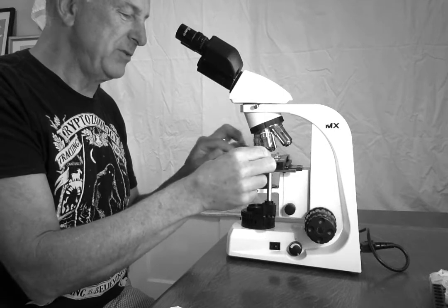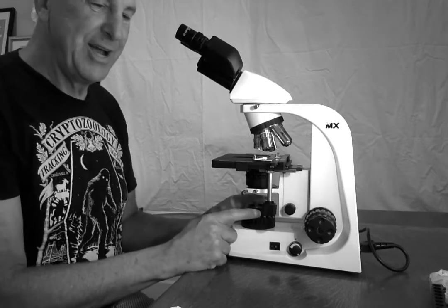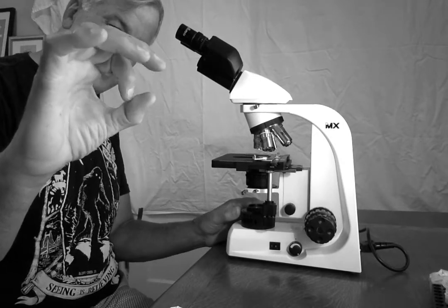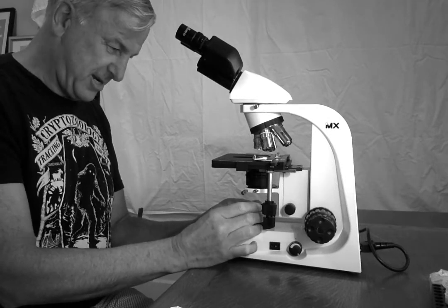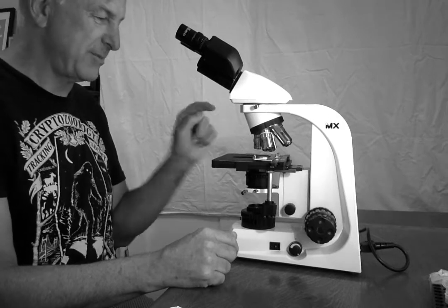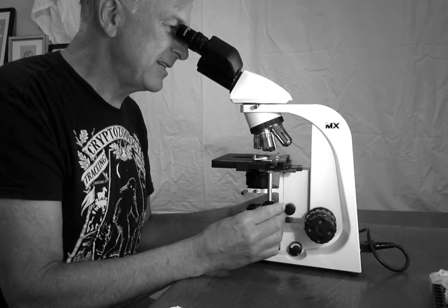So I'm going to remove the slide, set it here for later use, and I am going to go down to what's called the field diaphragm, which controls the amount of light coming through by opening and closing this diaphragm. So I'm going to close it all the way down, so I just see a tiny dot of light coming through here. As I look below, I can see it coming through from above, and I'm going to go back to my microscope. And I see kind of a polygon in here of light, a very tiny dot, but it's a little fuzzy.